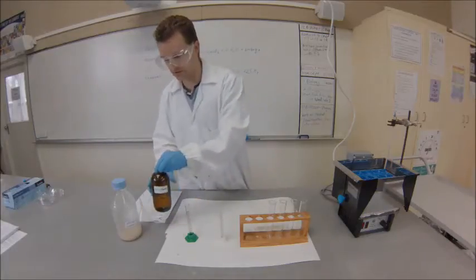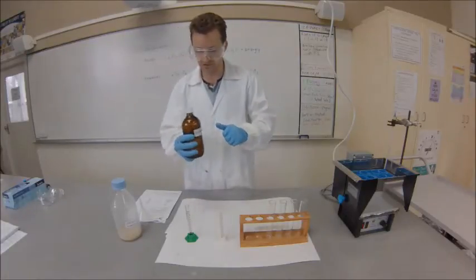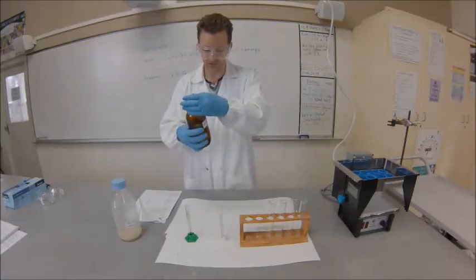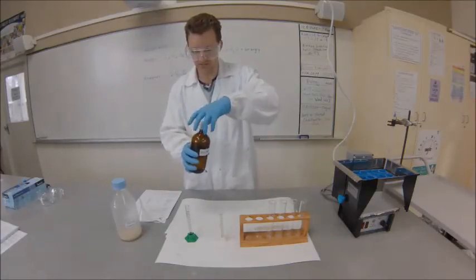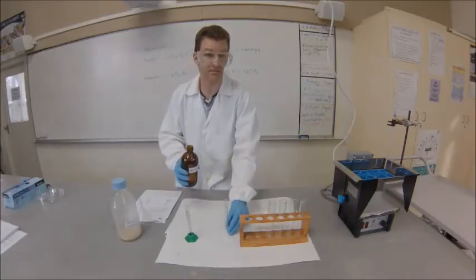We're going to measure out our solutions. Starting with the glucose solution - a quick mix to make sure it's dissolved, though it shouldn't be necessary. Then we'll get our measuring cylinder to measure out 10ml of the solution.